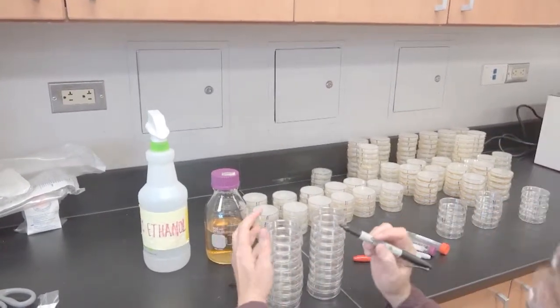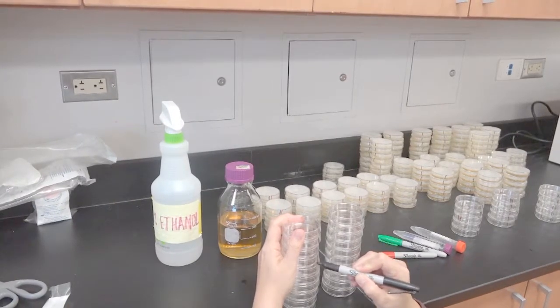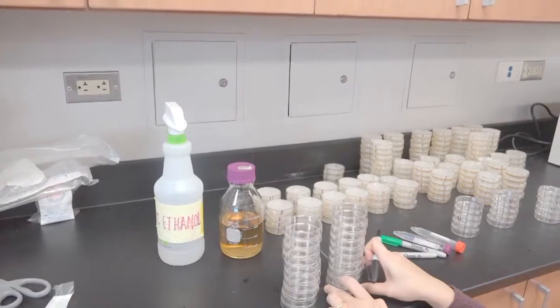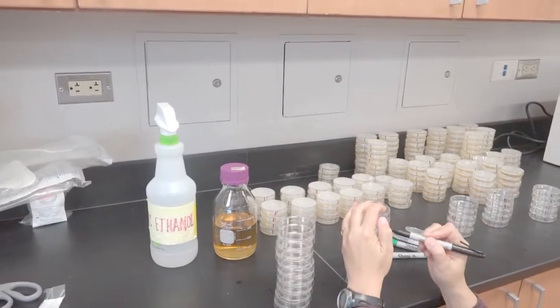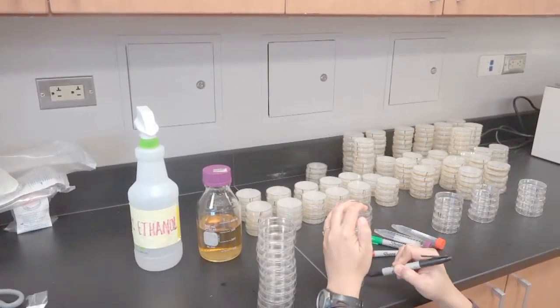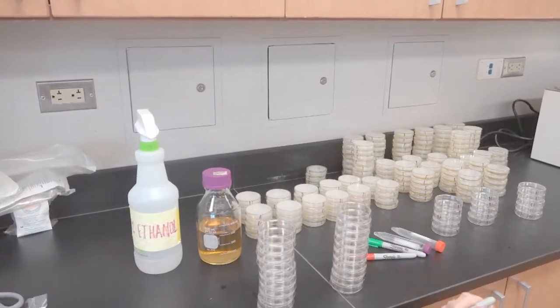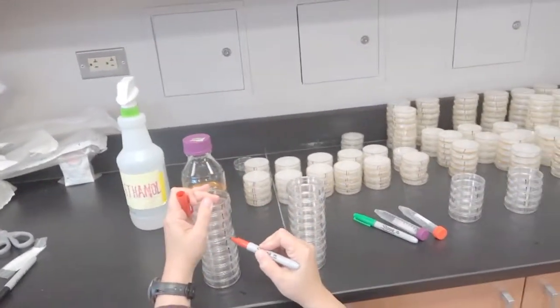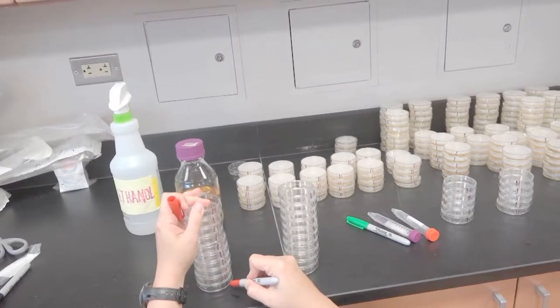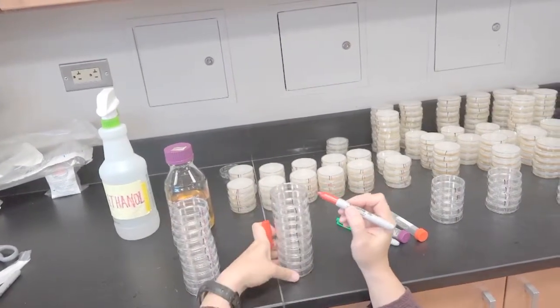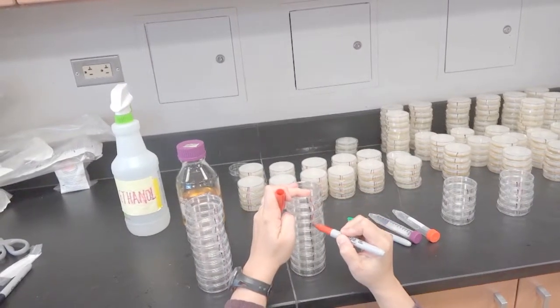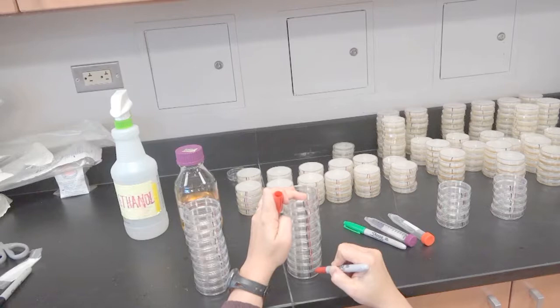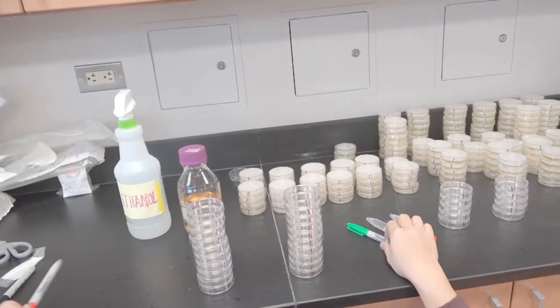We'll need all three lines on these plates. It's easy enough just to mark them quickly down the side. Once the black is done, we can do the red, and then the green.